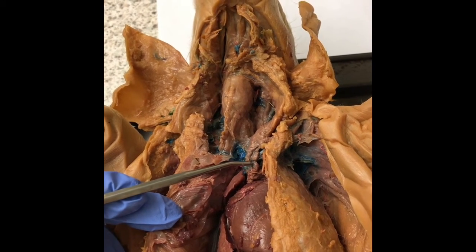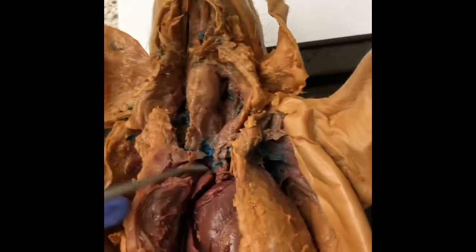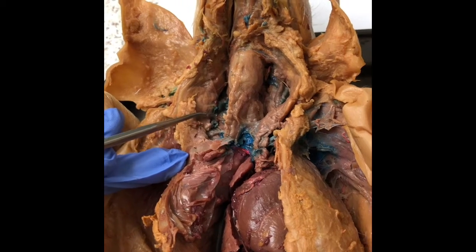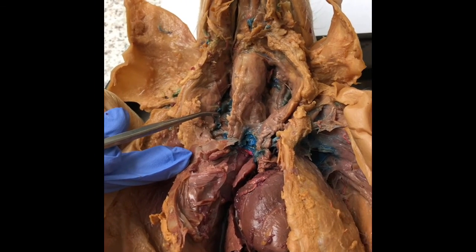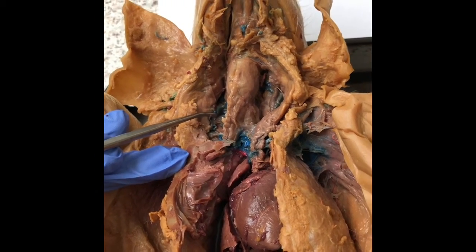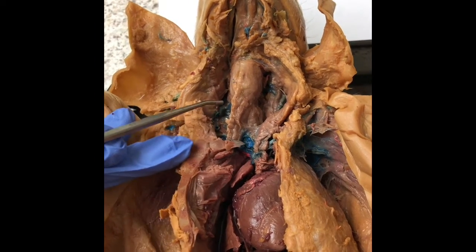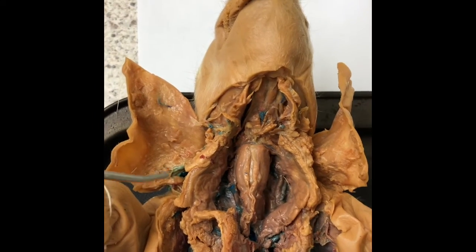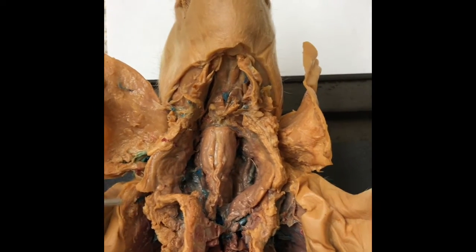Then there is the cephalic vein, which is located right there. The cephalic vein is where the blood flows from a variety of smaller veins and it drains into this vein. Okay, so I will be labeling 4 different parts of the fetal pig that I chose.